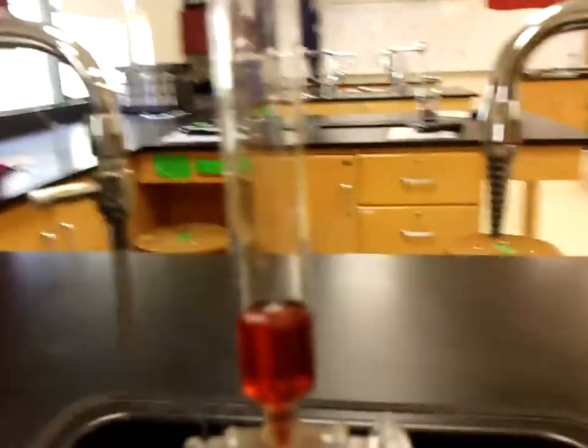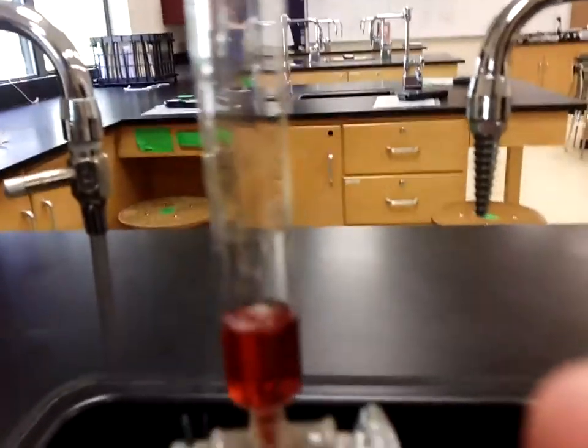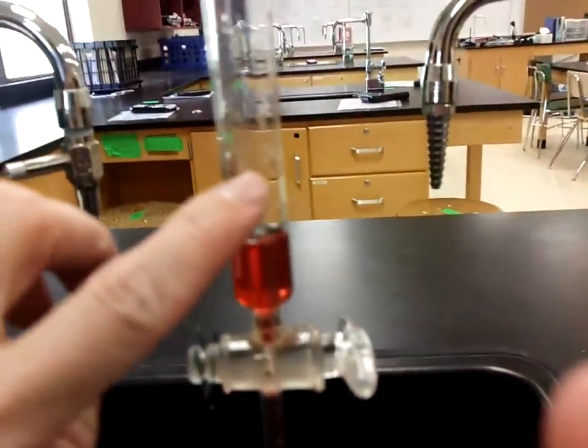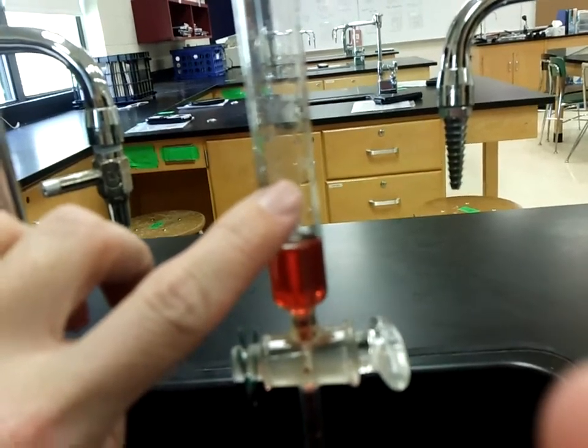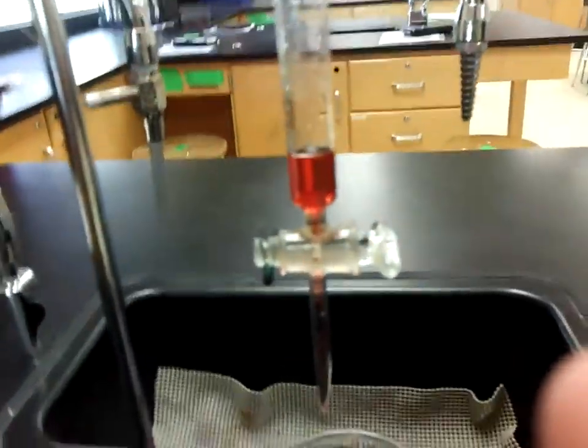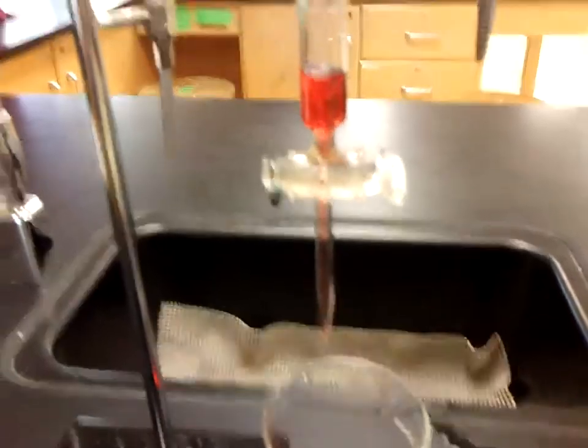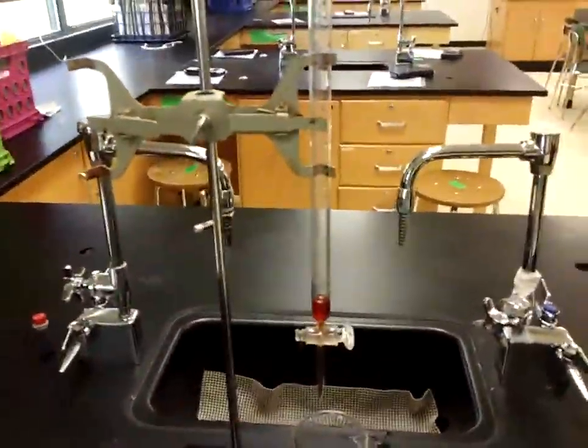Because if you stop right here and you were to take a measurement, this you can't see, but I don't have a line that tells me what volume is in there. So please make sure once again that when you fill up your burette, if my last volume reading is to here, there's no way I know what volume this is unless I've measured it beforehand. That's it.